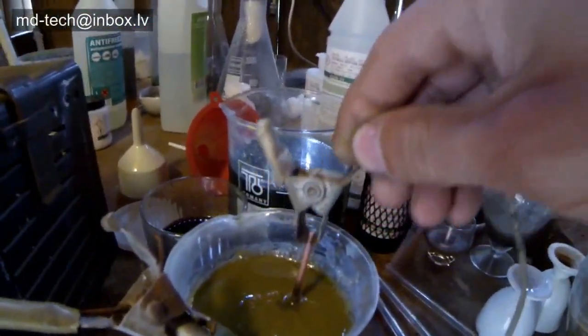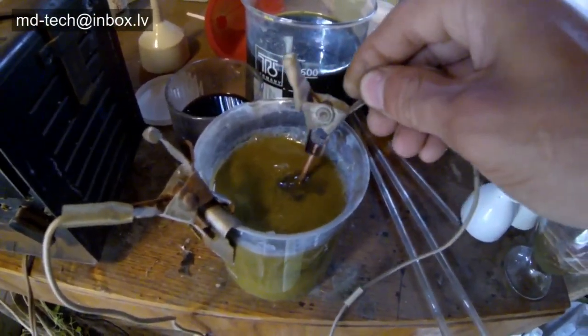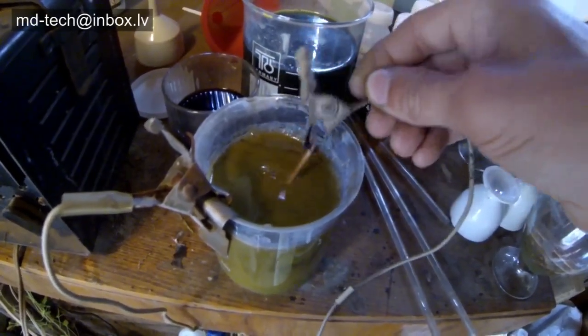This gold layer contains cobalt and nickel for hardness. Also, the copper is plated with a nickel underlayer. All of this is stripped off and very clean copper remains.